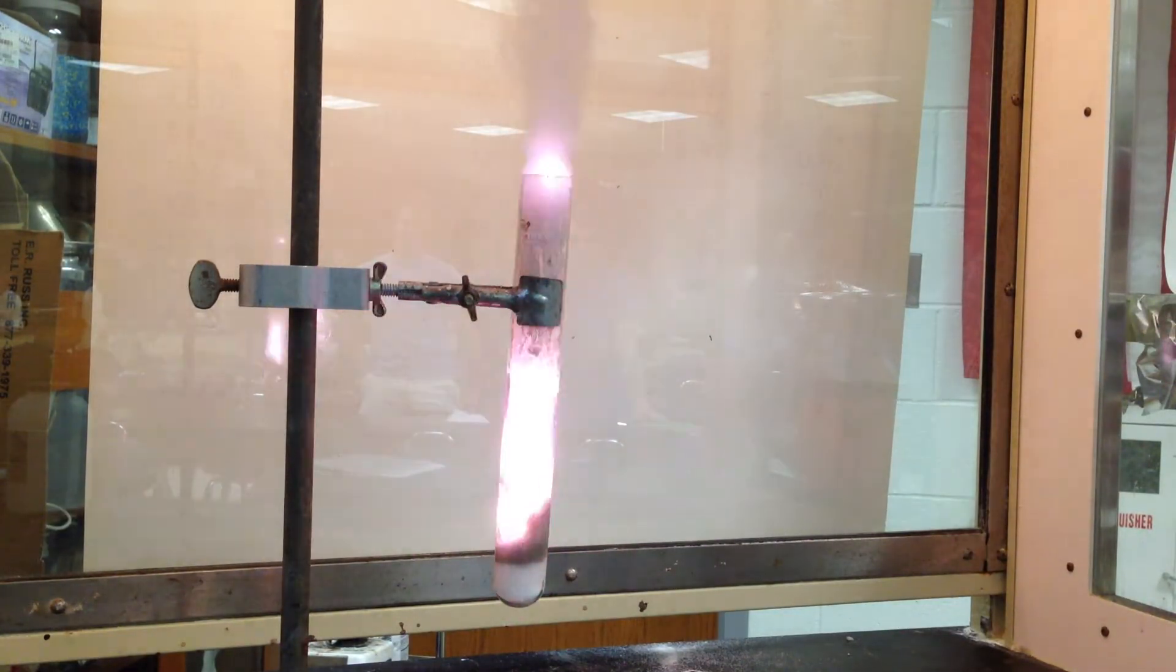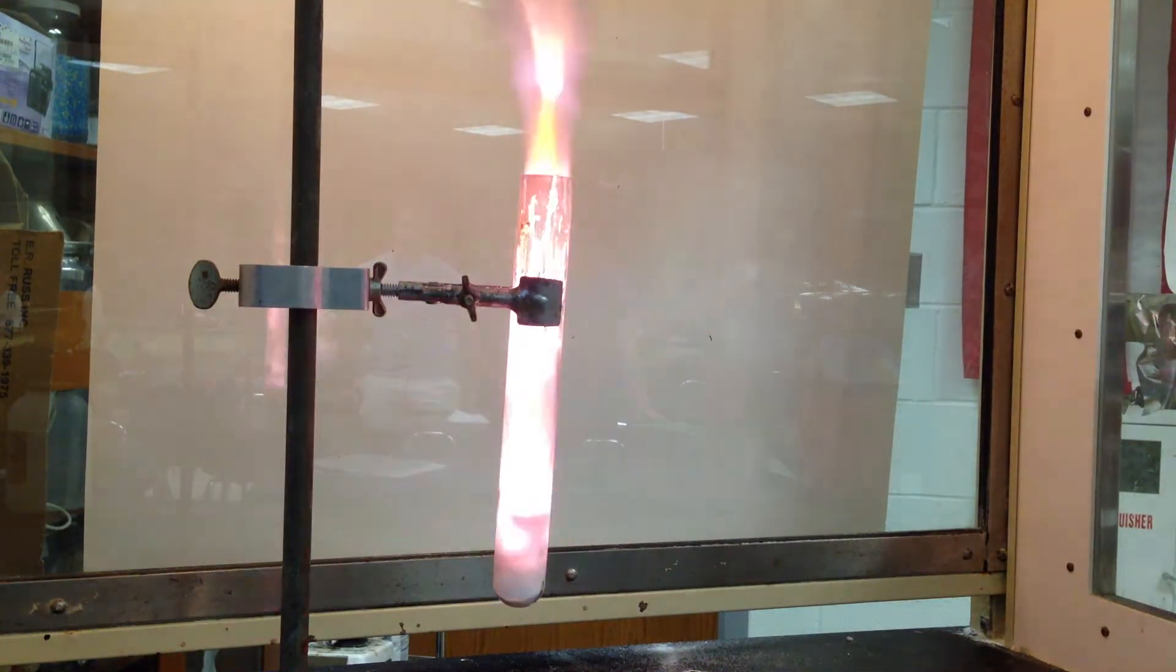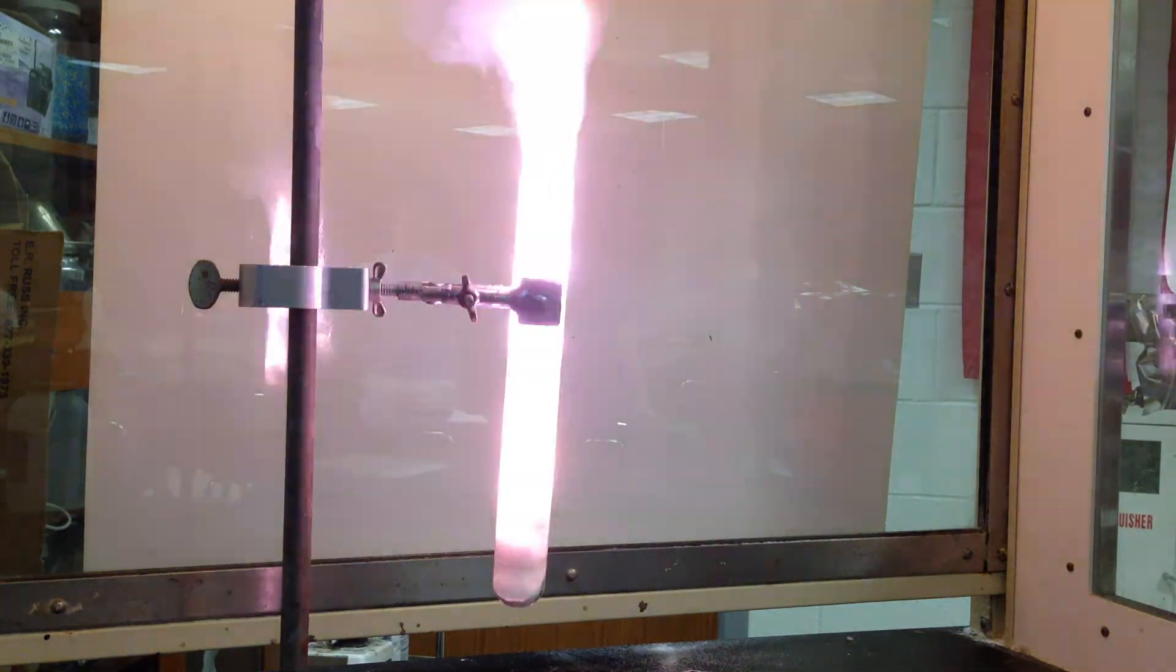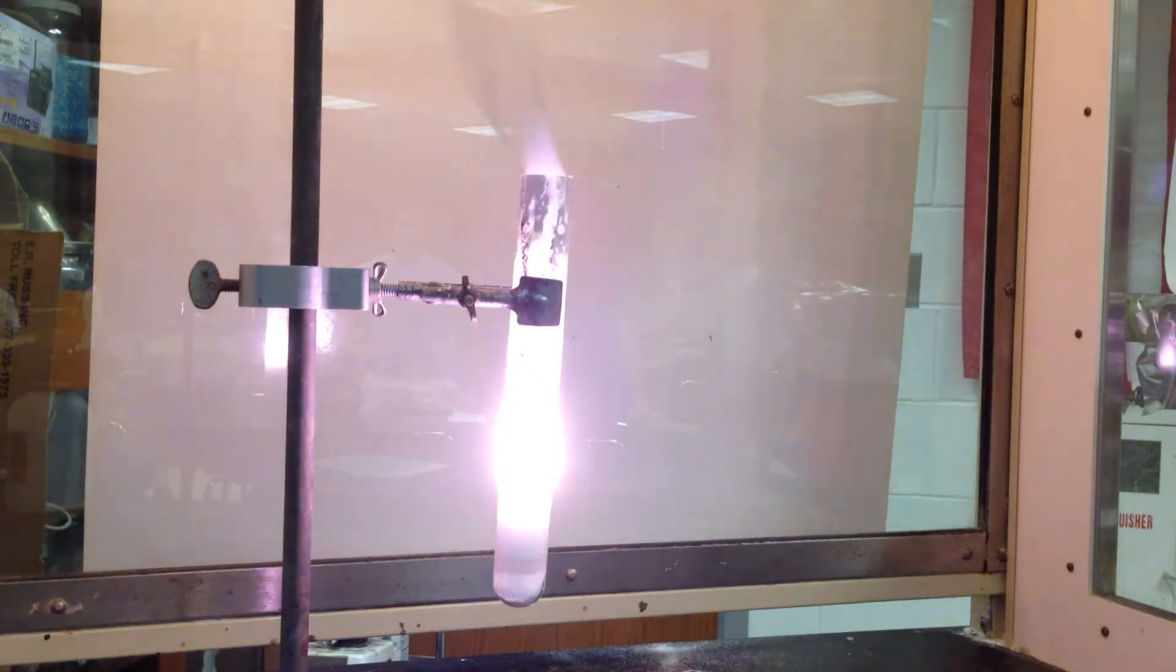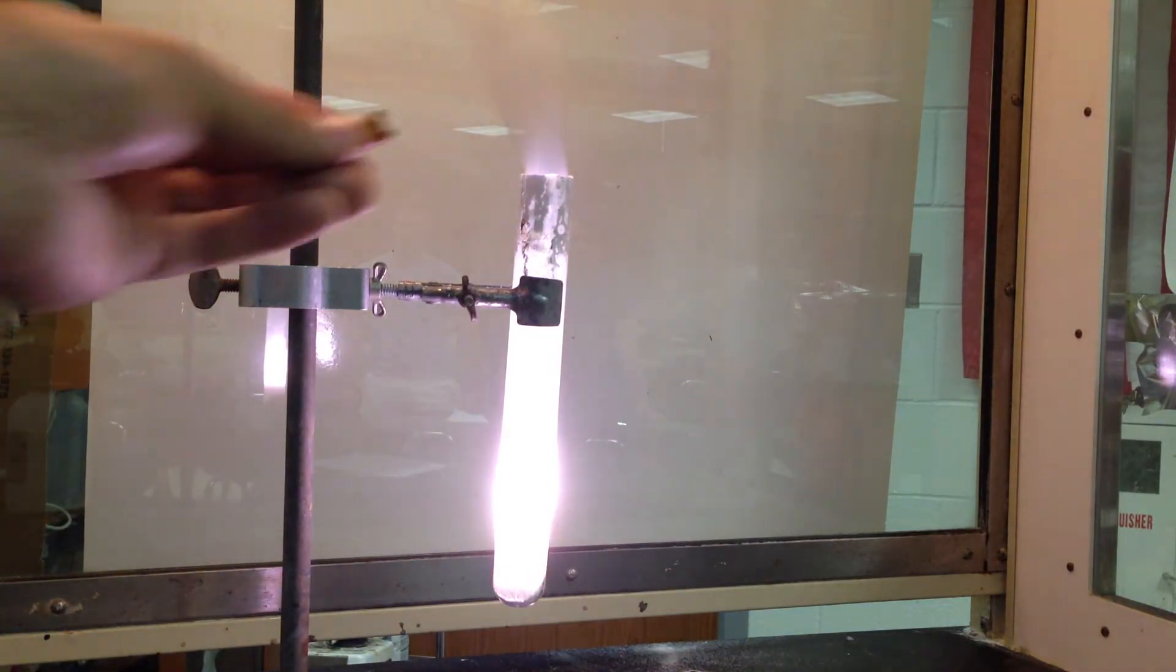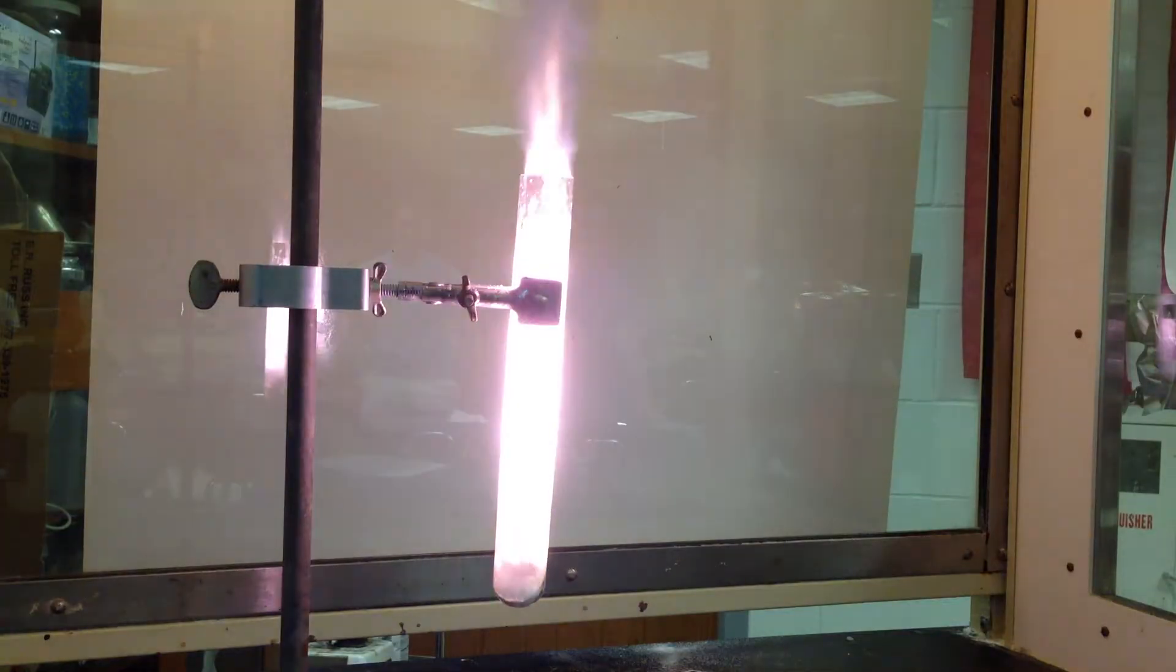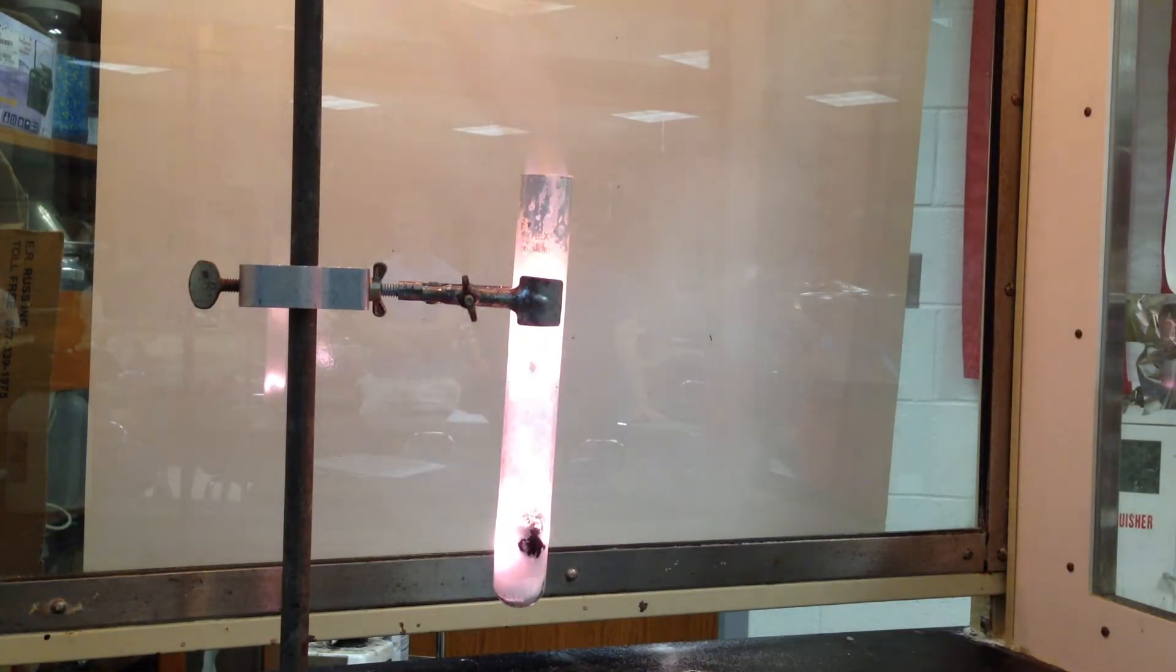Obviously a very exothermic demonstration. You're wondering where we're pumping out that gas. Make them dance. See the caramelized carbon on the bottom.